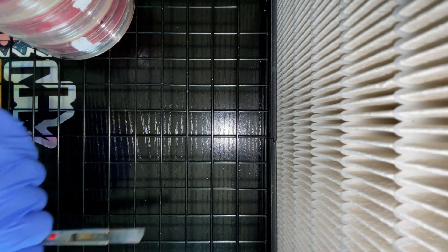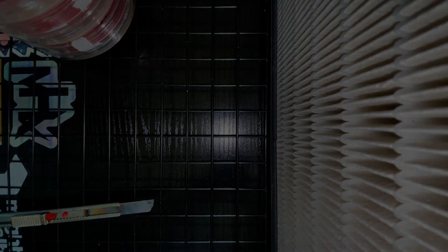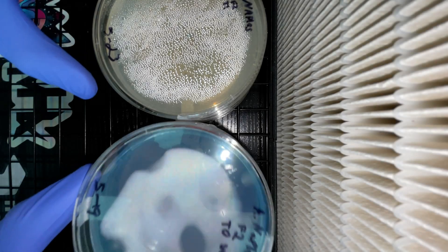I'm also making sure that I flame sterilize my blade in between transfers, as that would not be good at all to accidentally put two different genetics on a plate.